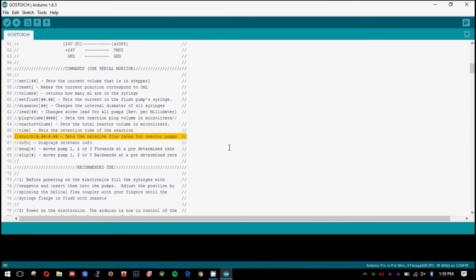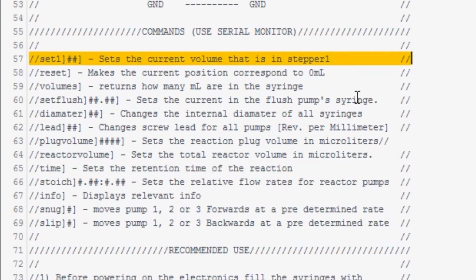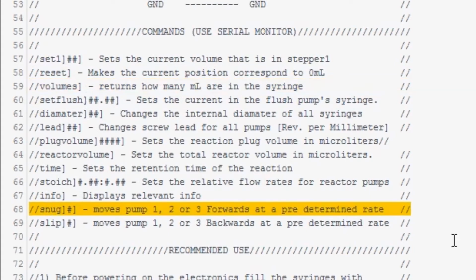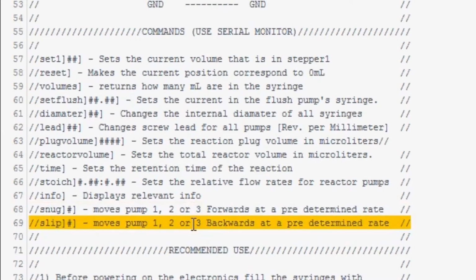Stoich is a variable that requires 2 numeric inputs, separated by a colon mark. These numbers control the relative flow rates of the pumps, and do not necessarily control stoichiometry unless equimolar solutions are prepared. Then it does. Time is the desired reaction time in seconds. Set 1, set 2, and set flush are used to inform the volume that is currently in the syringe. Volumes is a non-numerical command and it returns the volume in each syringe. Snug, followed by 1, 2, or 3 after the first bracket, is used to move pump 1, pump 2, or the flush pump forwards, independent of each other. This is used to adjust the position of each pump before initiating an experiment. Analogously, slip is used to move the respective pump backwards.